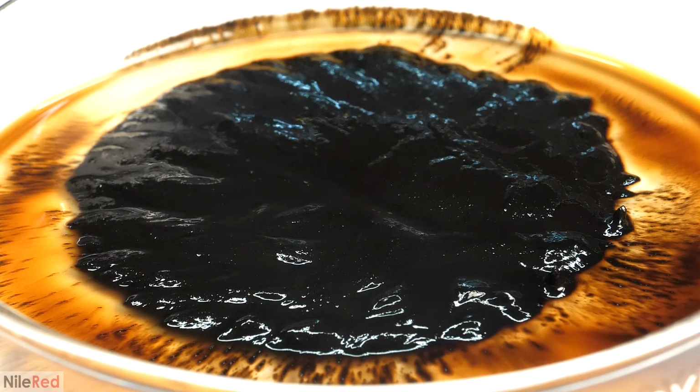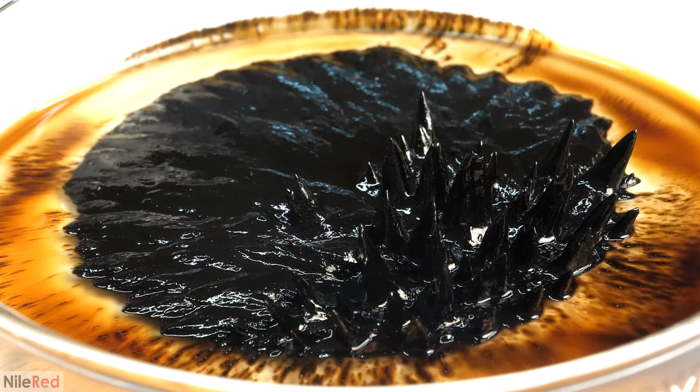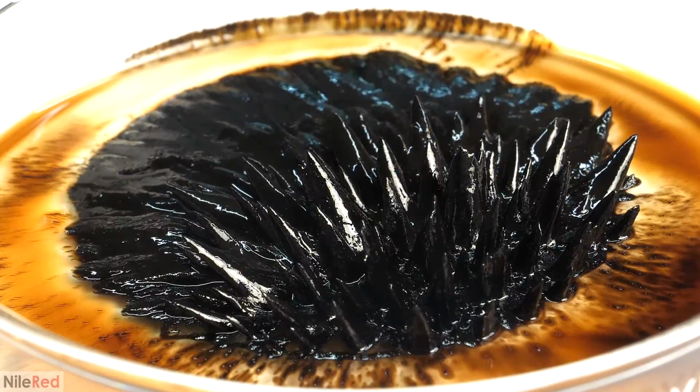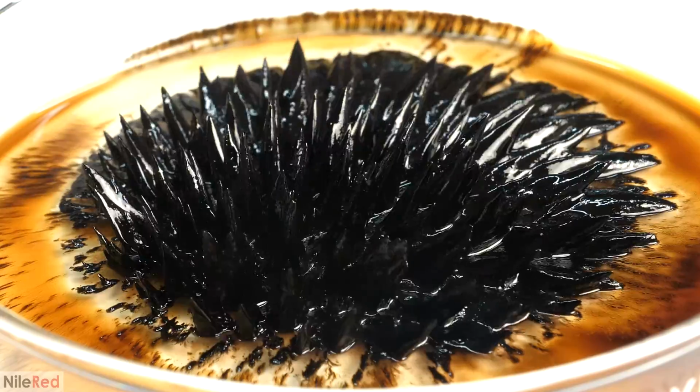In other cases, though, when the run was a complete failure, I ended up with particles that were all way too big. So pretty much all of them were pulled out by the magnet, and the solidifying effect was much stronger. And because of all the solid content, it was still able to form spikes, but they were a lot sharper.